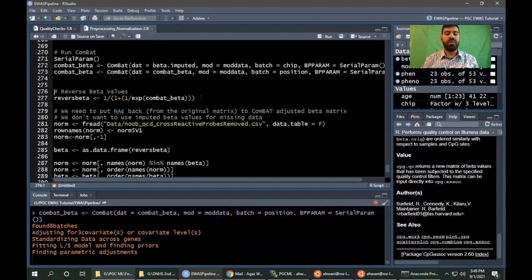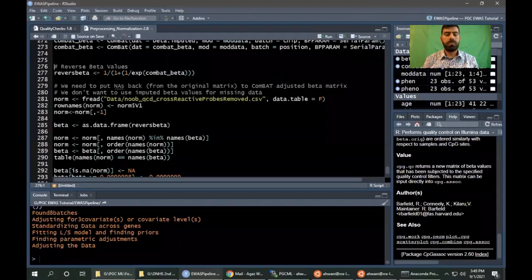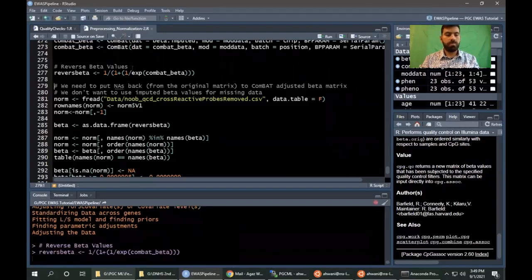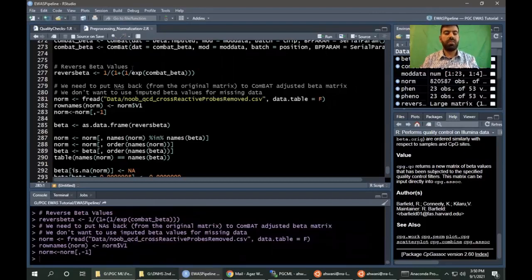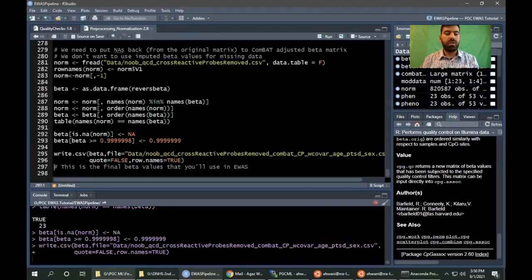After ComBat adjustment, we will convert the data back to beta values, so that the data is in the 0 to 1 range. Converting the data back, and inserting the NA values back because we imputed the data for ComBat adjustment, so we need to put the missing values back. And we will finally save the data that is ComBat adjustment normalized. After the sex check, we will save the final data so that we can use it in the downstream analysis.